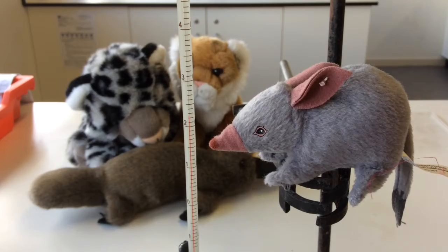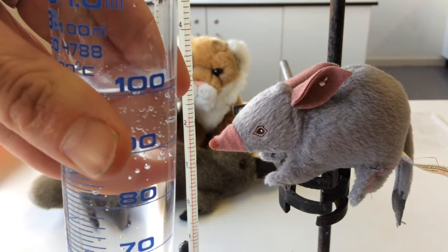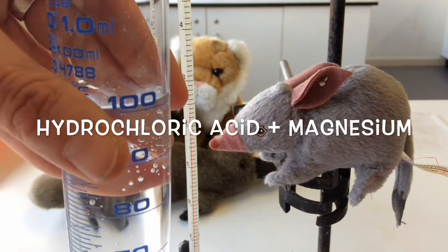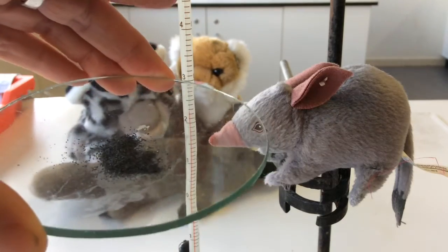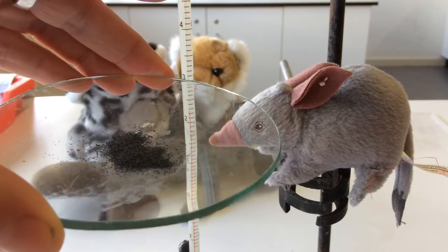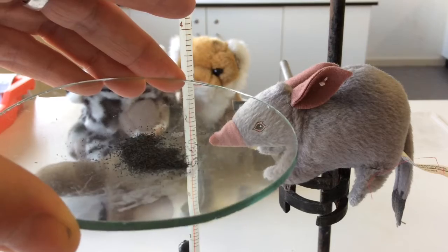Okay, so I've just measured out the 2 chemicals that you'll be requiring. I've got my 100 ml of hydrochloric acid. I do need to put that in the calorimeter and allow the temperature to settle. The other chemical we're placing in is the magnesium powder. Now this is the experiment where I said the student put in 2 grams instead of 0.2.